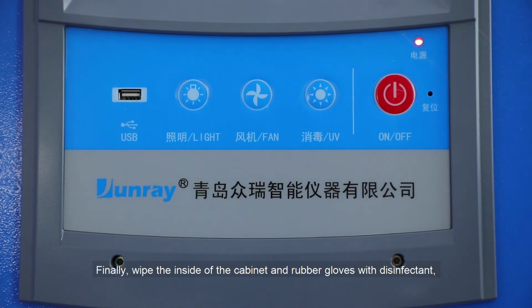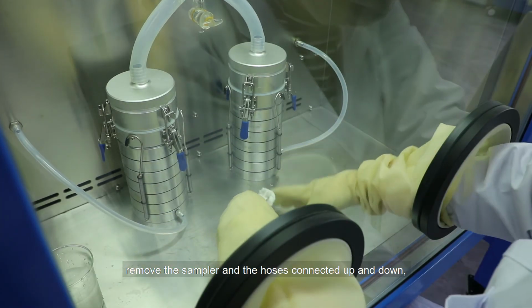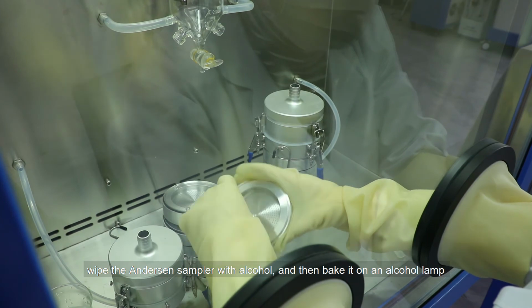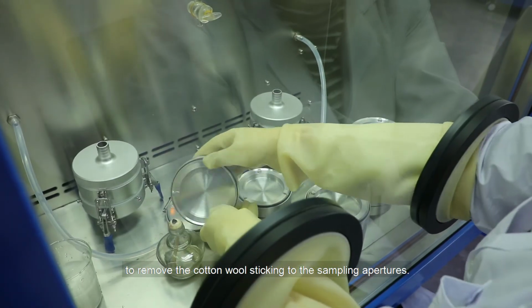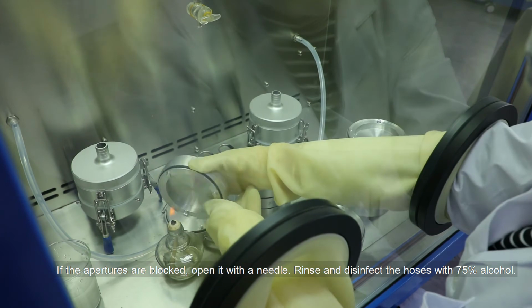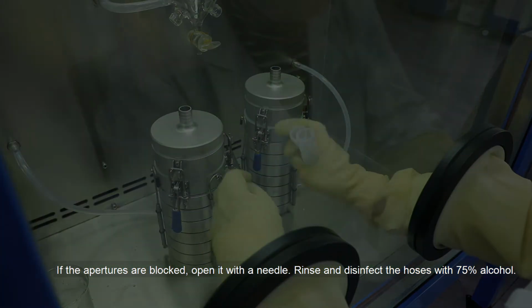Finally, wipe the inside of the cabinet and rubber gloves with the disinfectant. Remove the sampler and the hoses connected up and down. Wipe the Anderson sampler with alcohol, and then bake it on the alcohol lamp to remove the cotton wool sticking to the sampling apertures. If the apertures are blocked, open them with a needle. Rinse and disinfect the hoses with 75% alcohol.